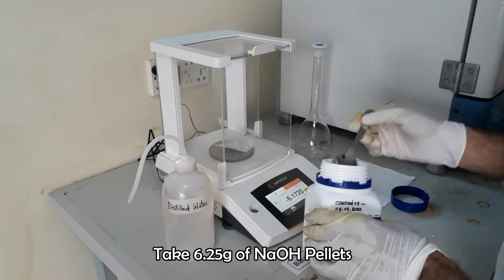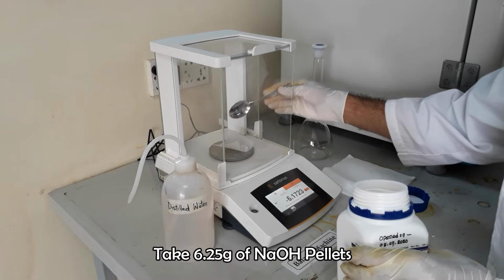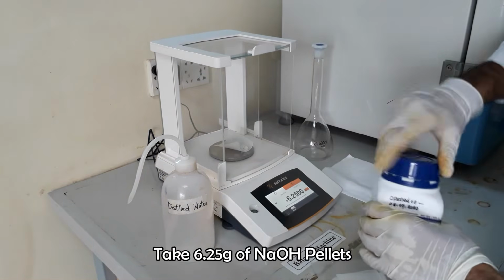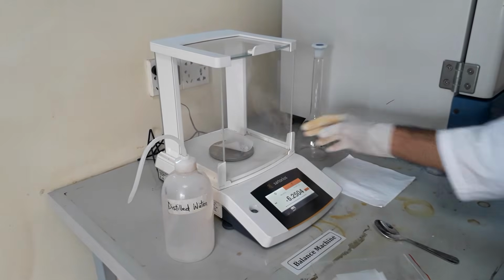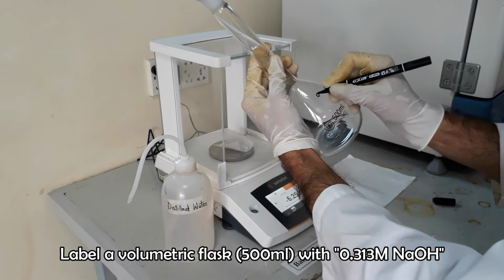Weigh 6.25 grams of sodium hydroxide pellets. Label a volumetric flask.